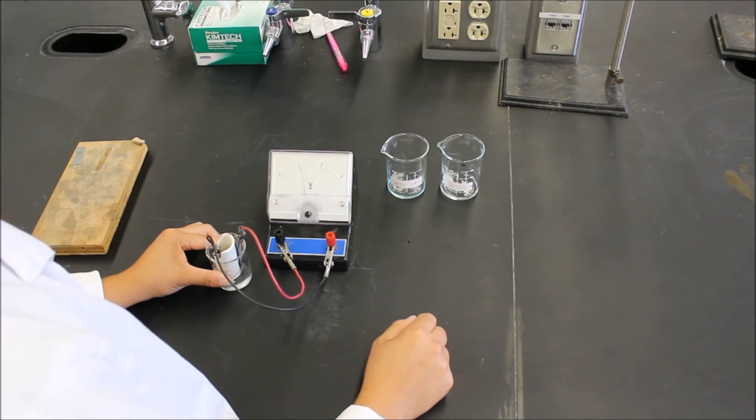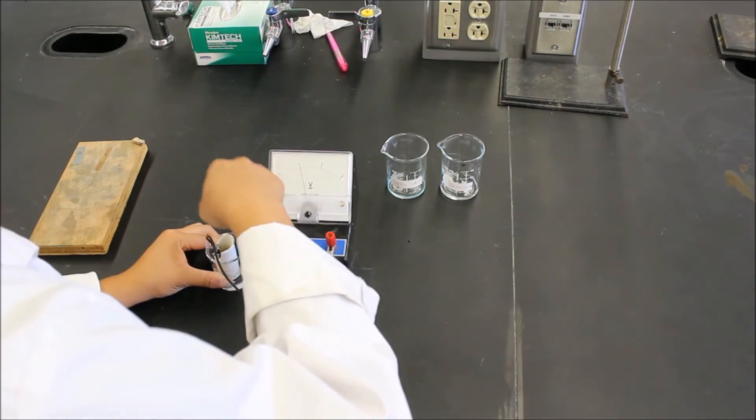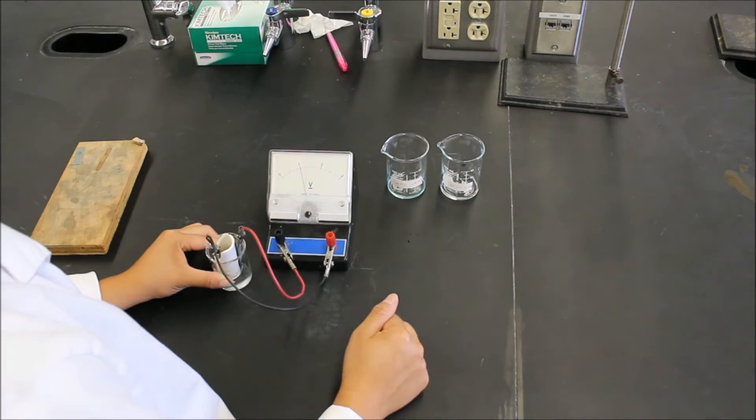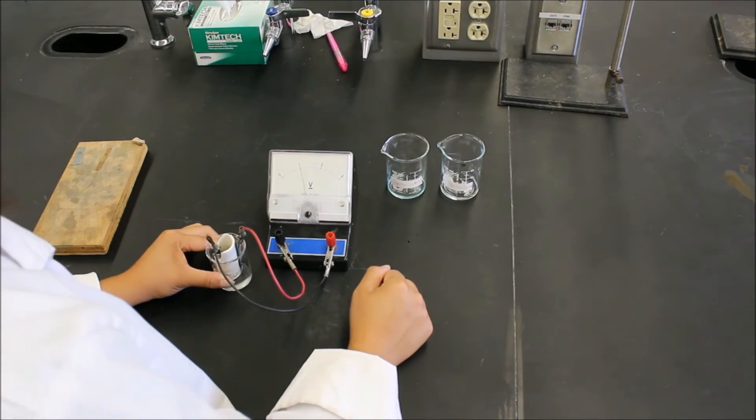Just like that, make sure you record your data. And these solutions may be reused. So you can just put them back in the cups and we can continue on with the rest of our experiment.